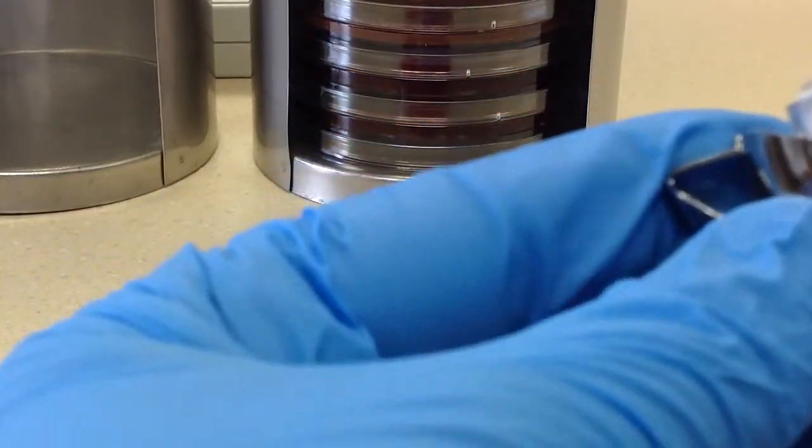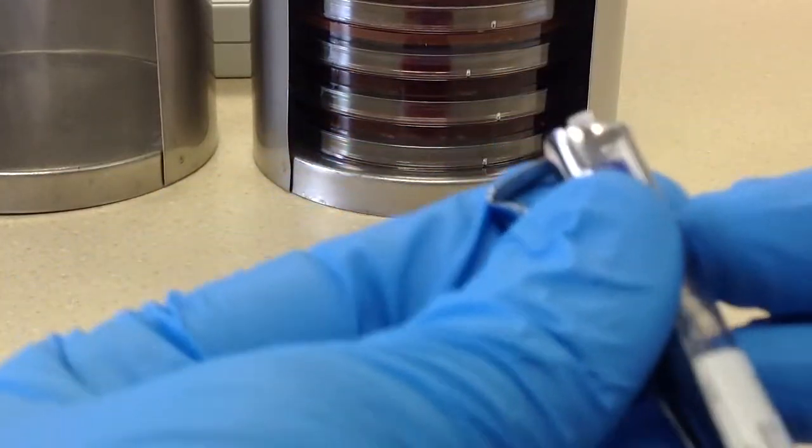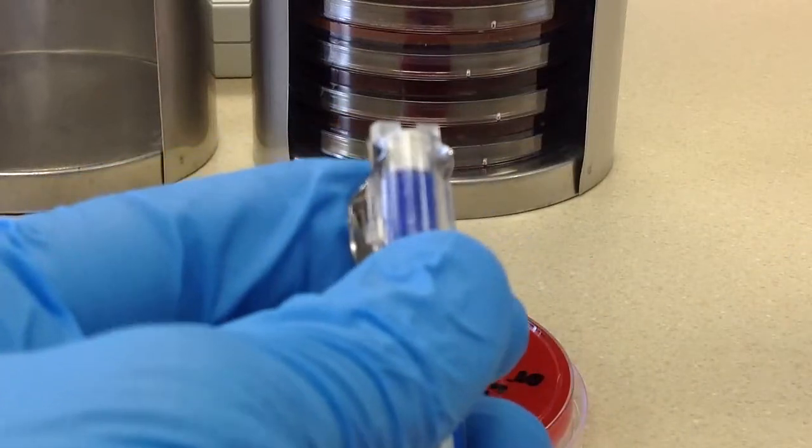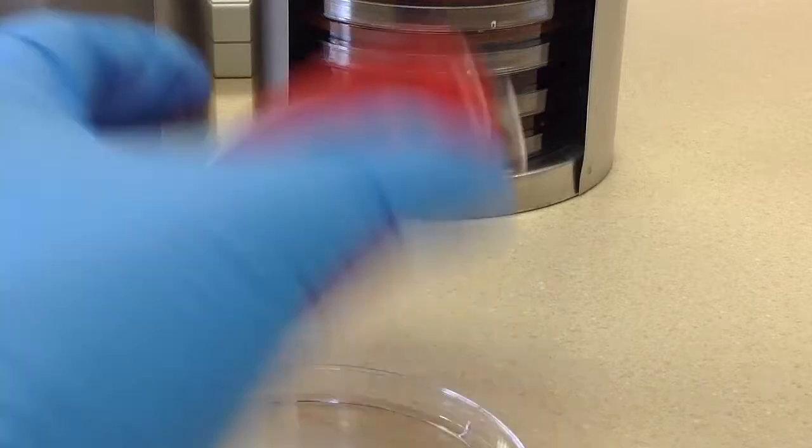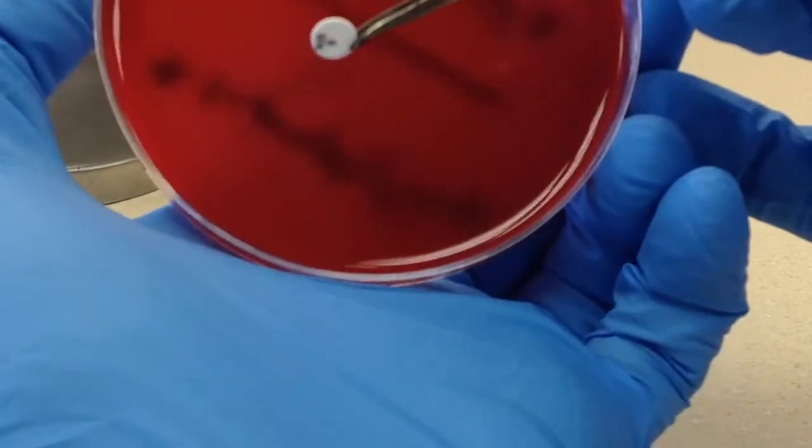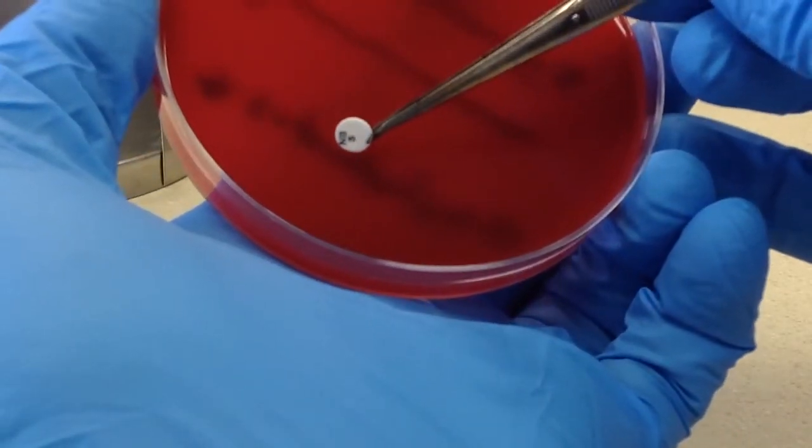And since I have two organisms, it seems kind of obvious. I would need two discs, one for each. Tap that.